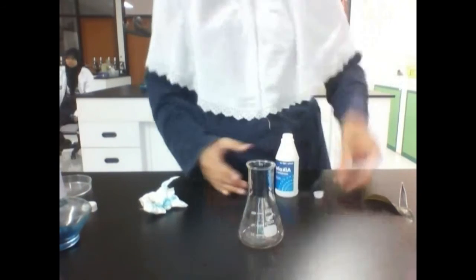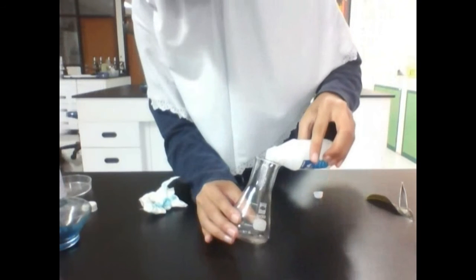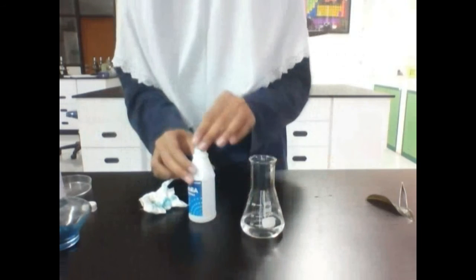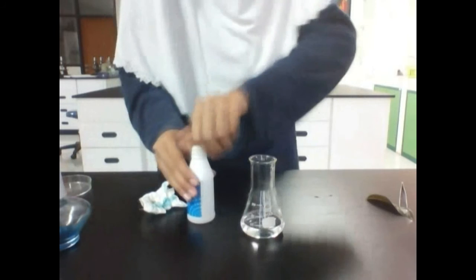But first, you have to pour the alcohol into the flask. You don't need that much alcohol, but at least the alcohol will cover all the parts of the leaves.